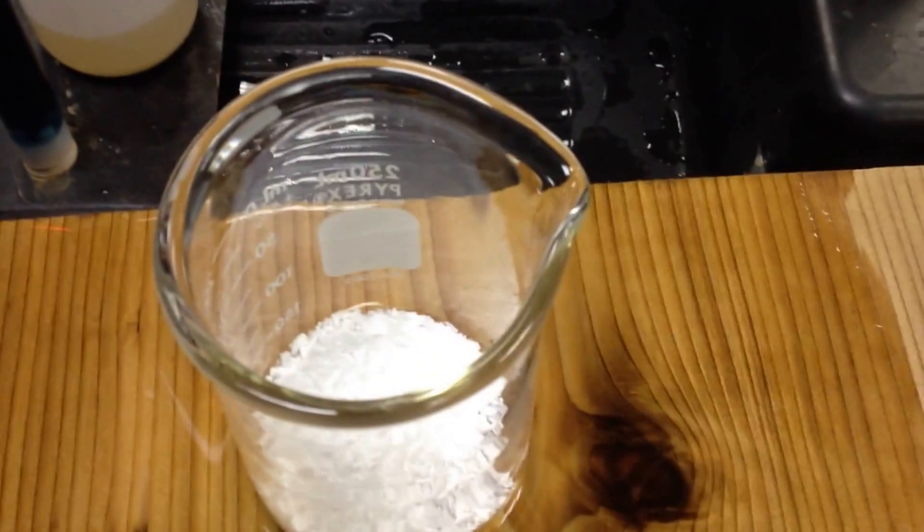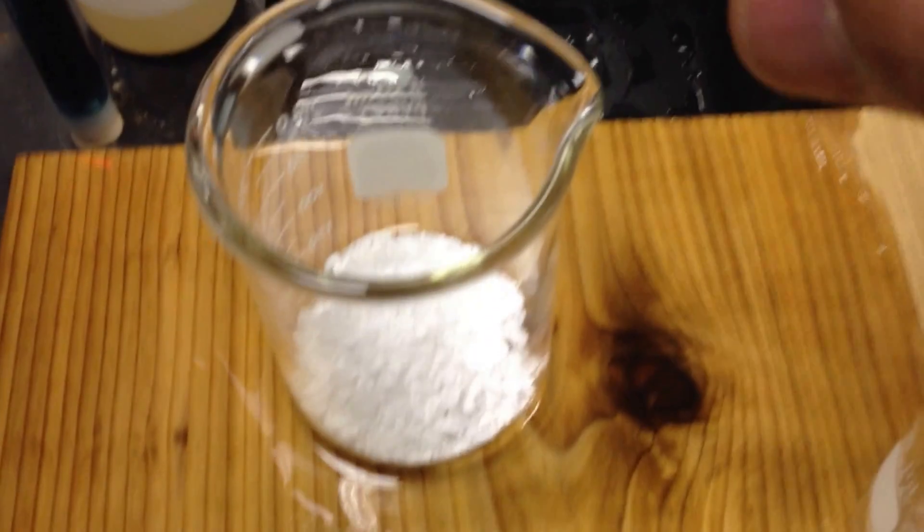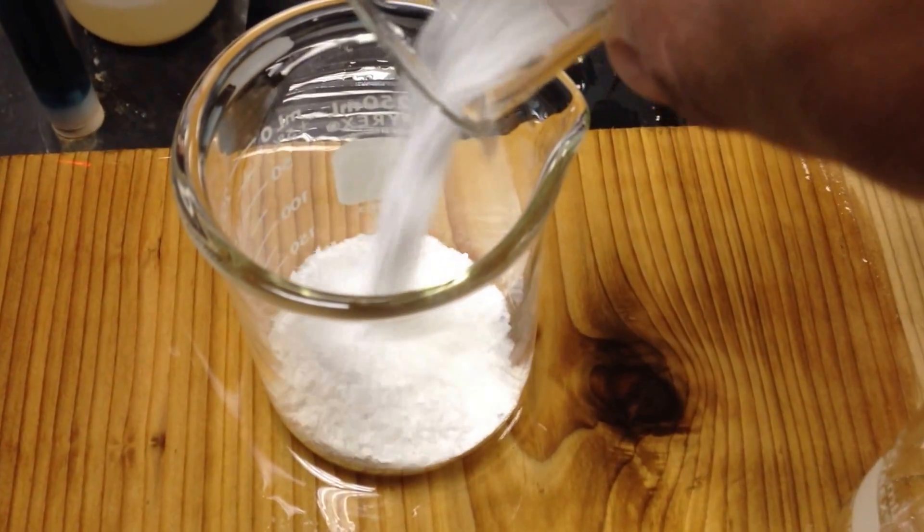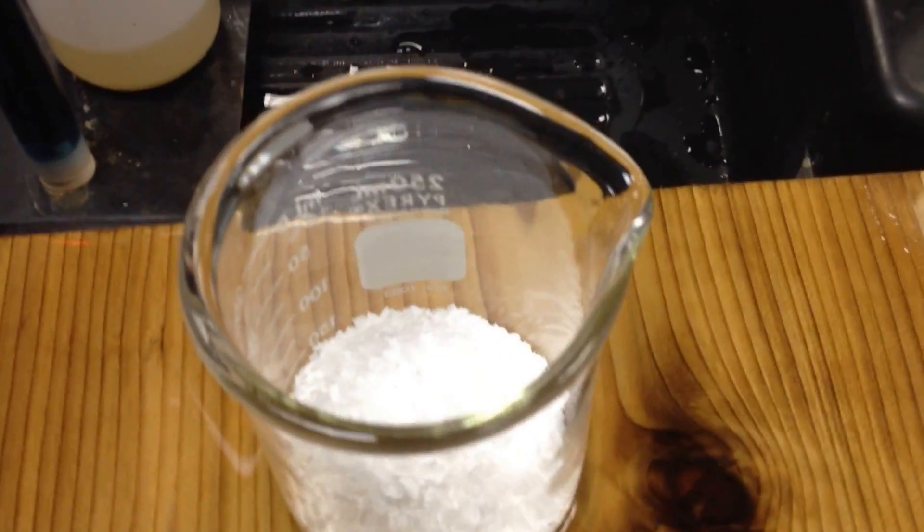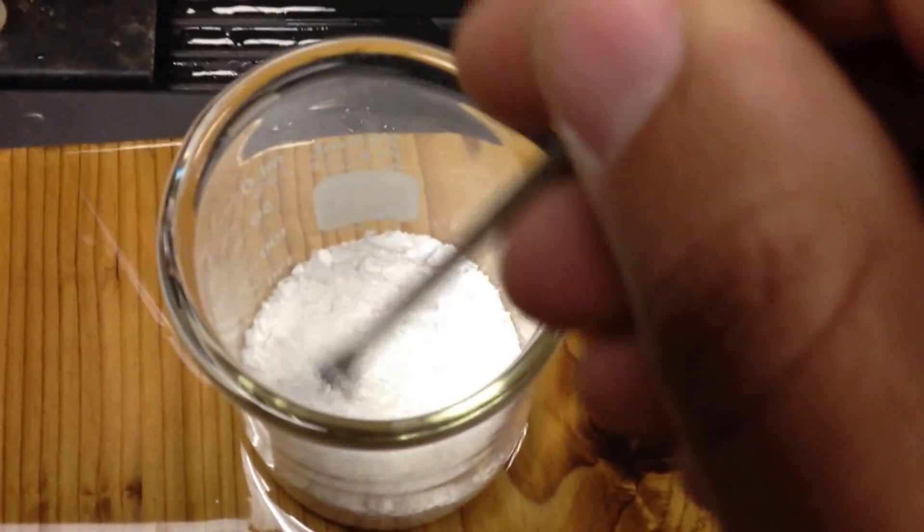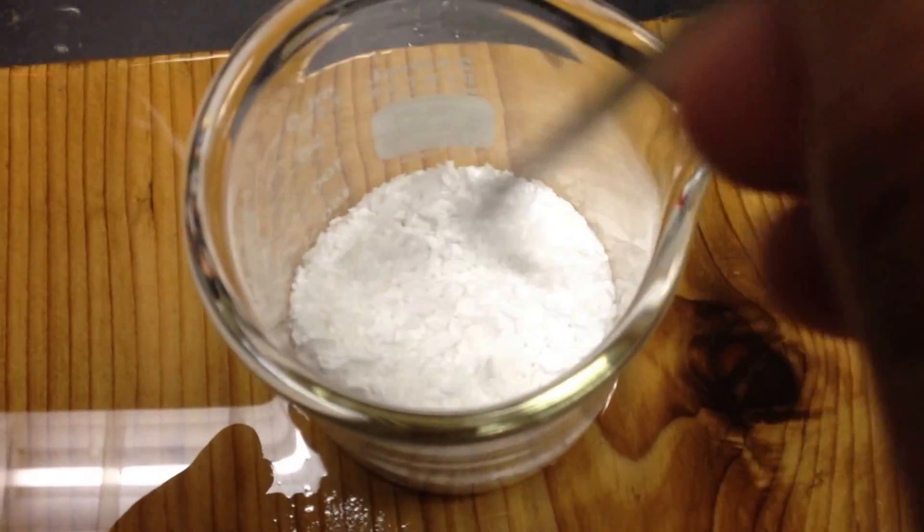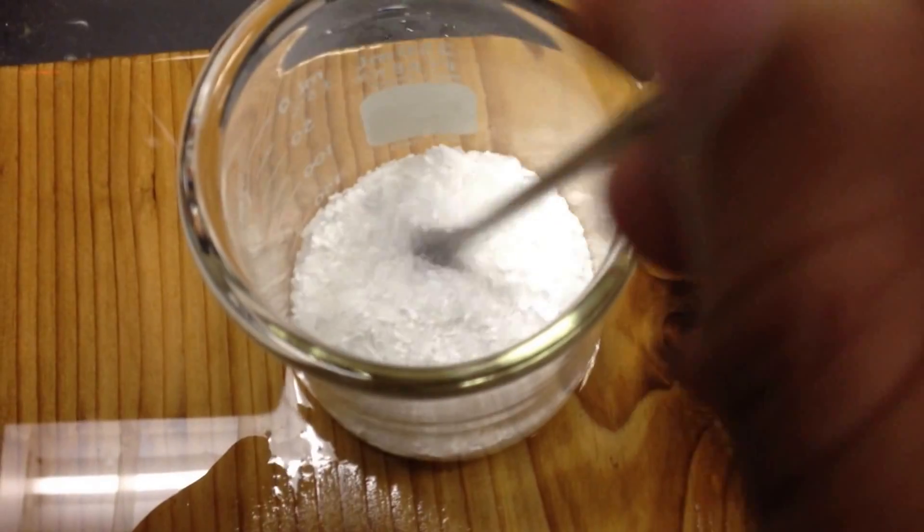It was nice knowing you. Okay, guys. Craziness. Now, I'm going to stir like no tomorrow. So as I stir, any changes you see?